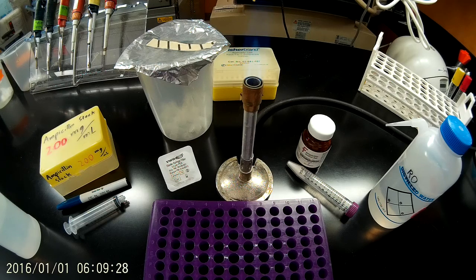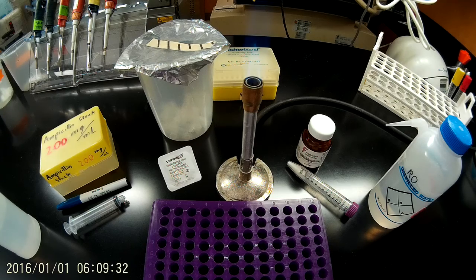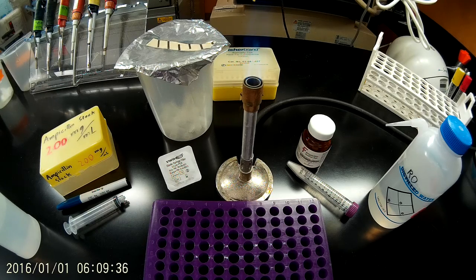Although ampicillin is a powder, it's much more convenient to use as an aqueous solution, so we typically store frozen aliquots or portions of ampicillin at a concentration of either 100 or 200 milligrams per milliliter.